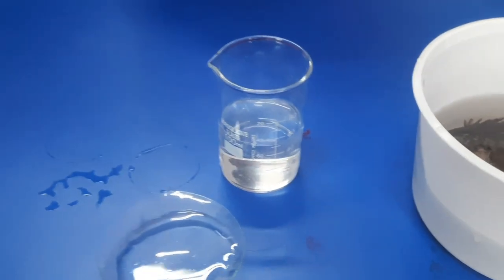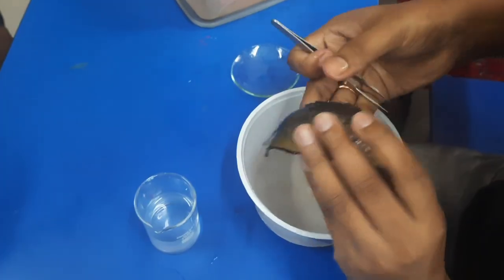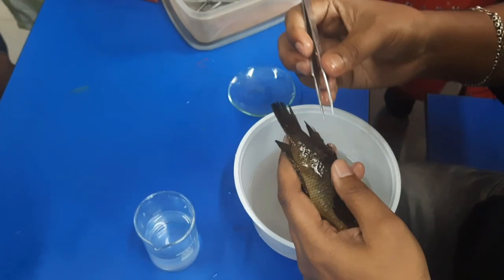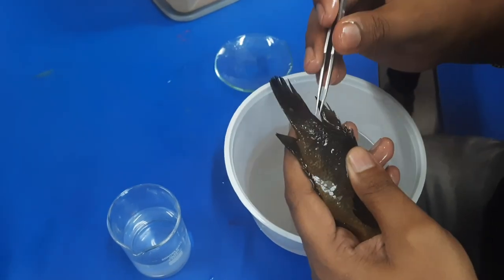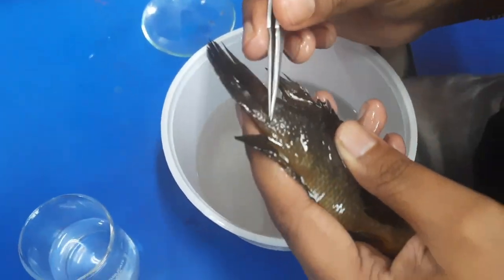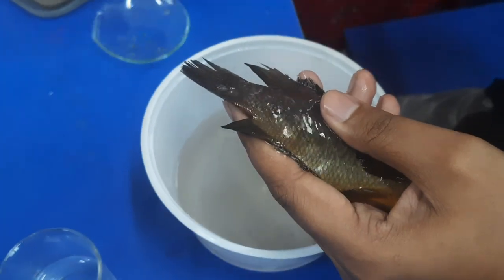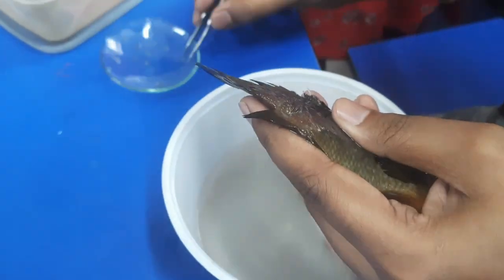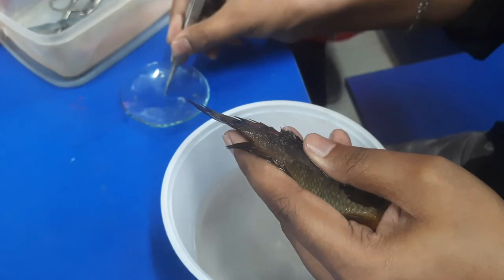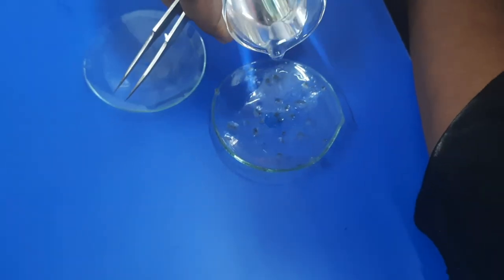Hello viewers, welcome to Academy of Bioscience. Today in comparative anatomy practical, we are doing mounting of cycloid and ctenoid scale. We will use reagents and from those reagents we will isolate small scales. First we will isolate them carefully.